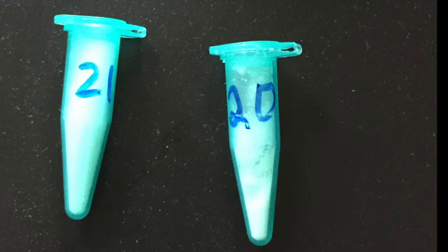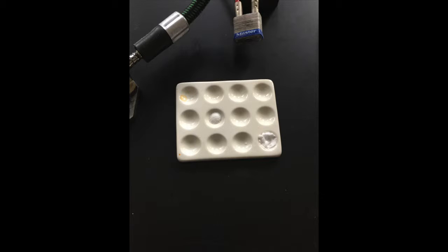From substance number 20, the group was able to determine that the particles were much more compact and they kind of looked like flour when combined. The substance itself was very powdery in nature, and it seemed almost as if it looked like small water molecules at times.